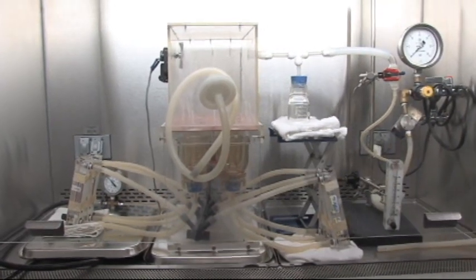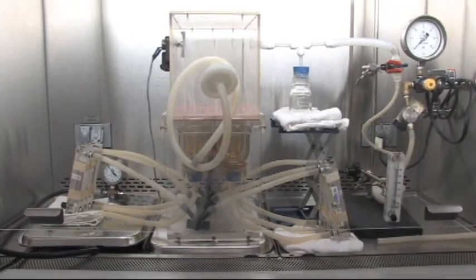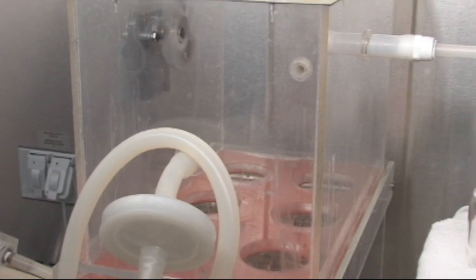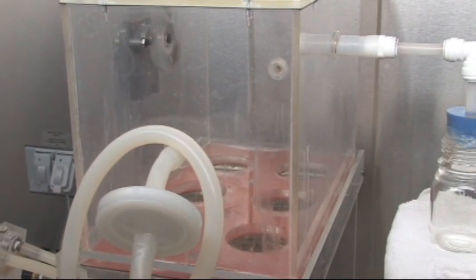At least two samples need to be tested of each material per the standard, but the test unit can accommodate up to four samples per run. Positive and negative controls are run in the other two slots.